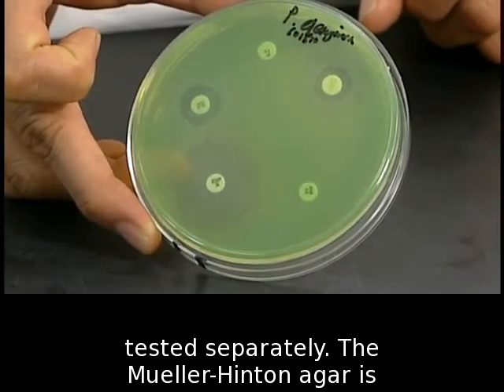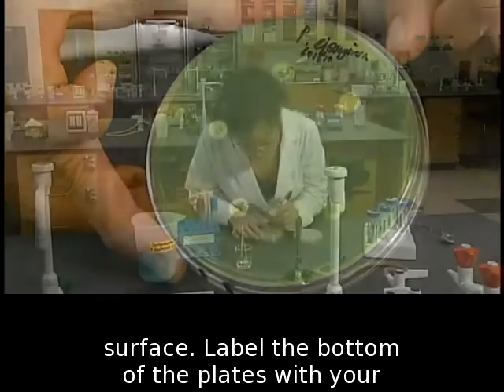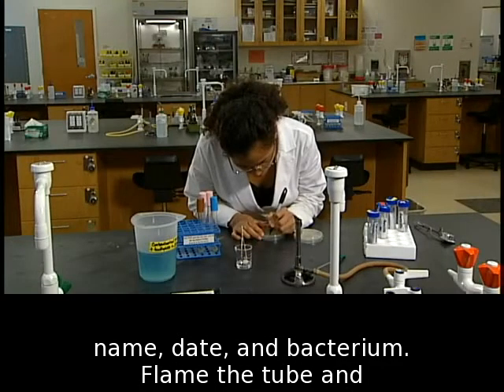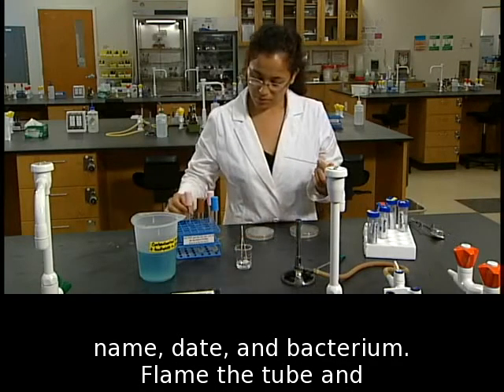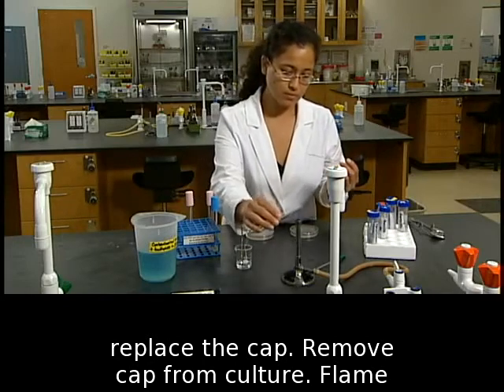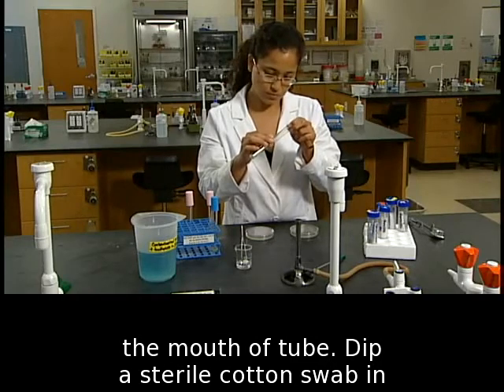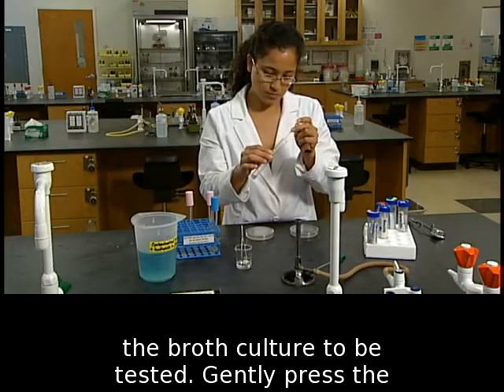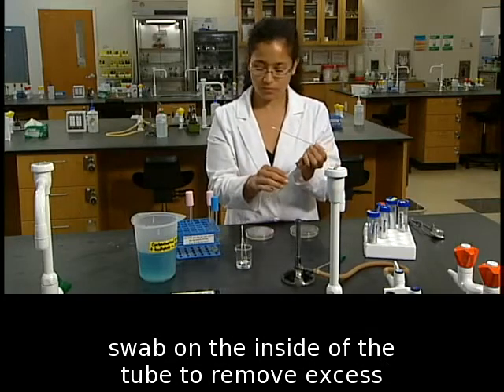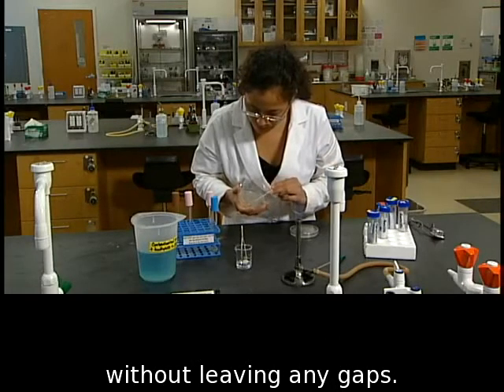The Mueller-Hinton agar is inoculated to get a lawn of bacteria on the surface. Label the bottom of the plates with your name, date, and bacterium. Flame the tube and replace the cap. Remove the cap from the culture. Flame the mouth of the tube. Dip a sterile cotton swab in the broth culture to be tested. Gently press the swab on the inside of the tube to remove excess liquid. Swab across the agar in one direction without leaving any gaps.